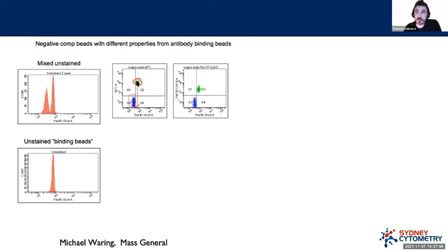So what the computer is going to interpret is, well, APC is spilling into Pacific blue, and it's going to correct it, which in the real sample is going to create some errors, because what's going on here does not represent what's actually happening in the sample. It's a really specific problem to have, but it actually does create errors, particularly in the violet region of the spectrum. And as a result, it's very important to tackle this properly, so these issues don't come up.